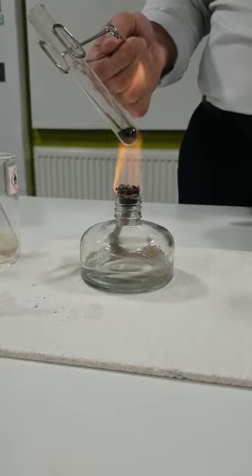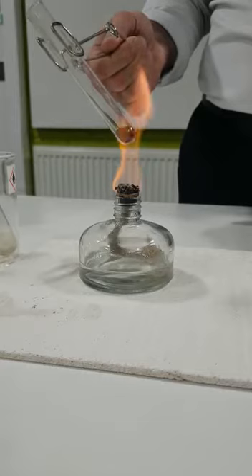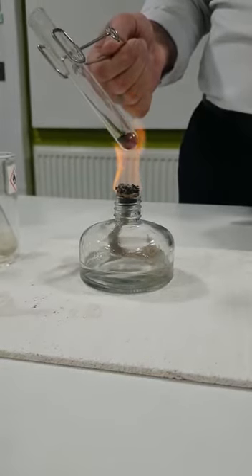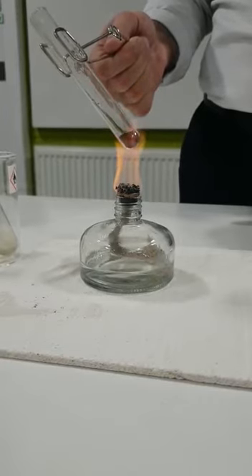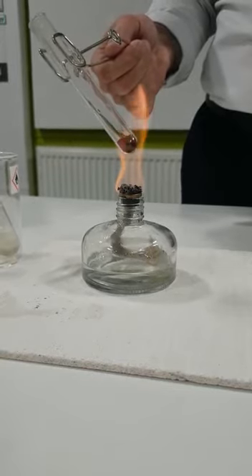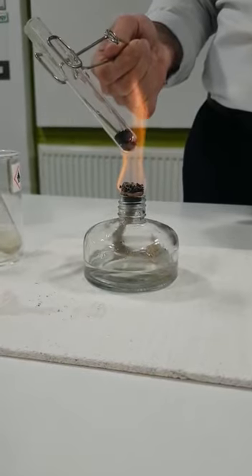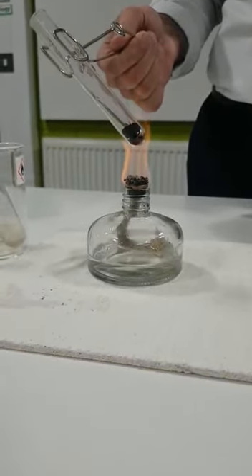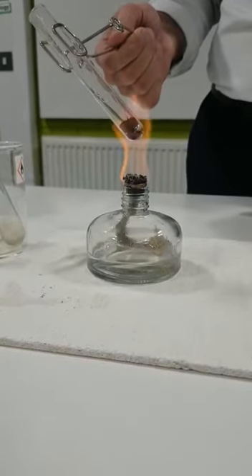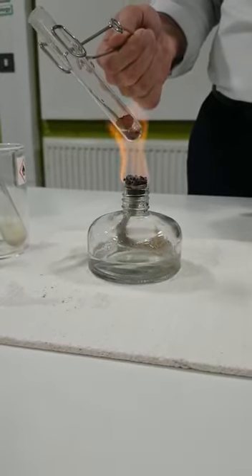See what your observation is, anything that you can observe. Do you observe that the gas pushed it up? Which gas was that? Where did it come from? And what does it mean in terms of the changes that we are observing? Is it chemical or physical? And also, what do you see in the appearance of the powder? Any change that you notice, you need to add it as your observation, and again explain why. It can help you to understand if it is chemical or physical.